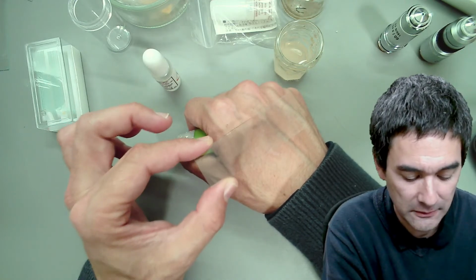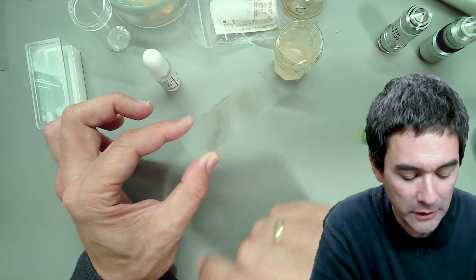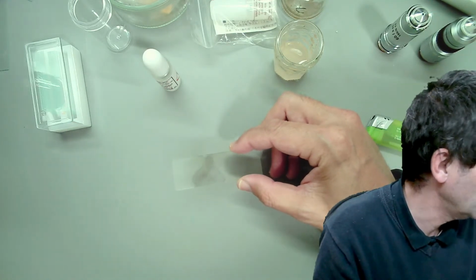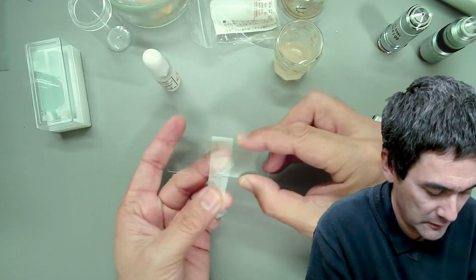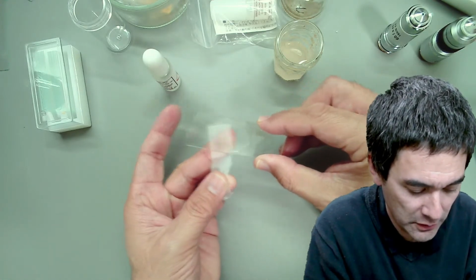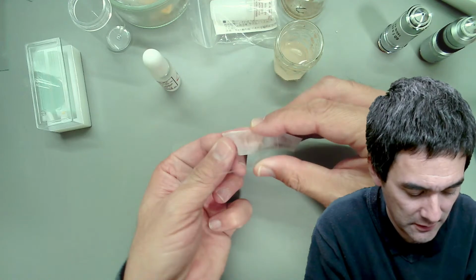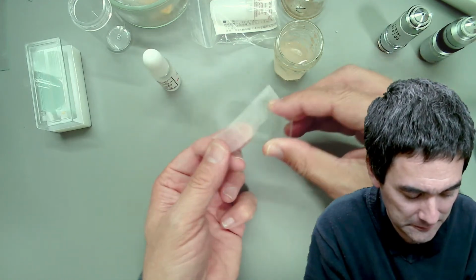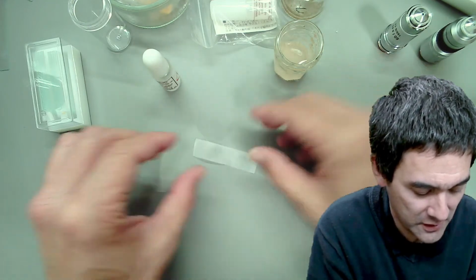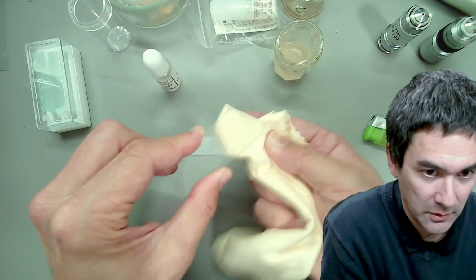Yes, this should be okay. It is very hot. You can also see that the color changed a little bit. It turned a little bit whiter. And now I'm going to wipe this somehow, so I'm going to clean off the soot. That's my mistake, and that's why you should use a proper Bunsen burner and not a candle or a lighter. But that's okay. I'm going to get it cleaned.